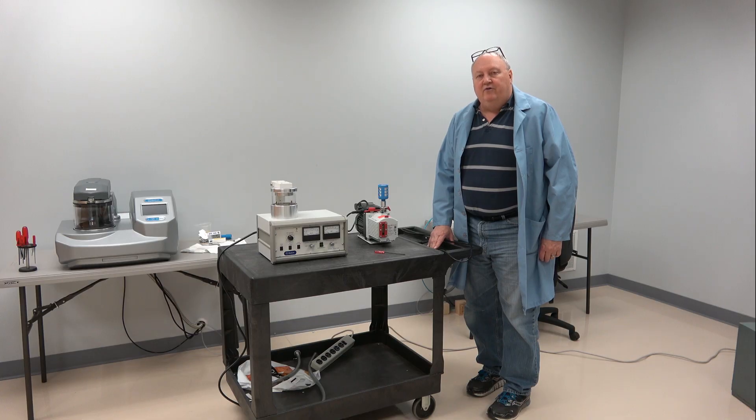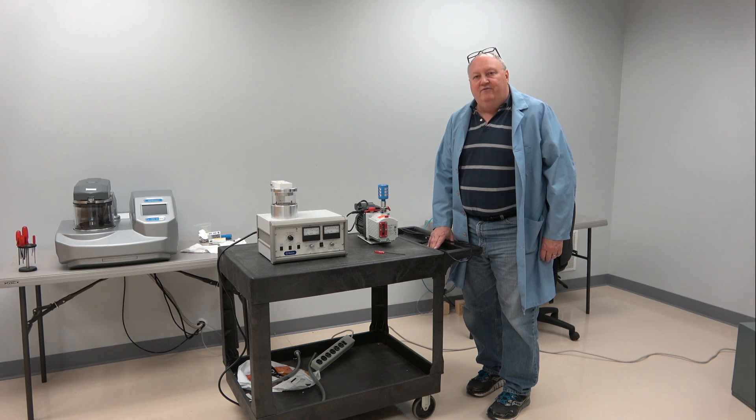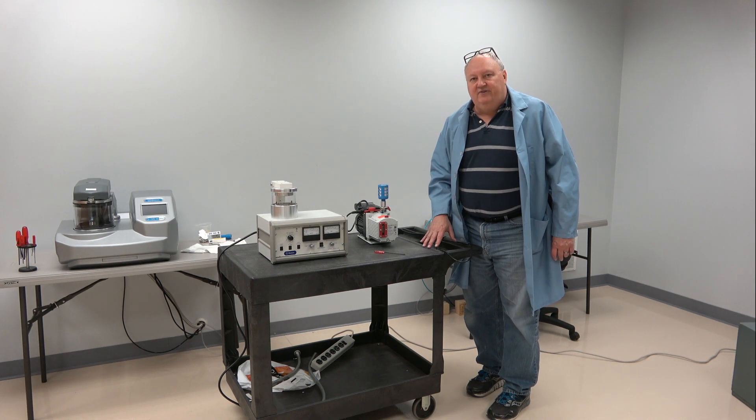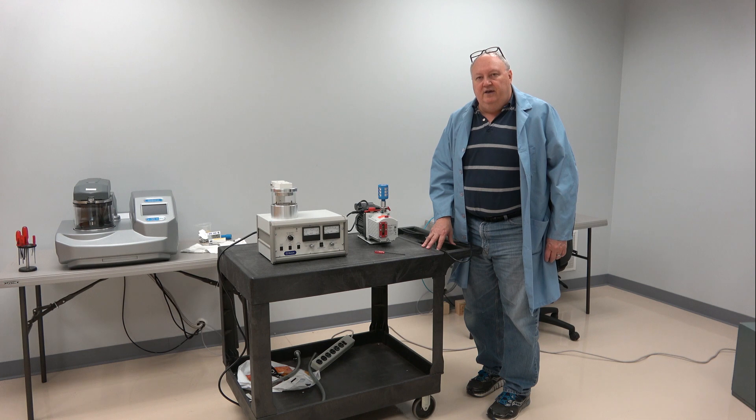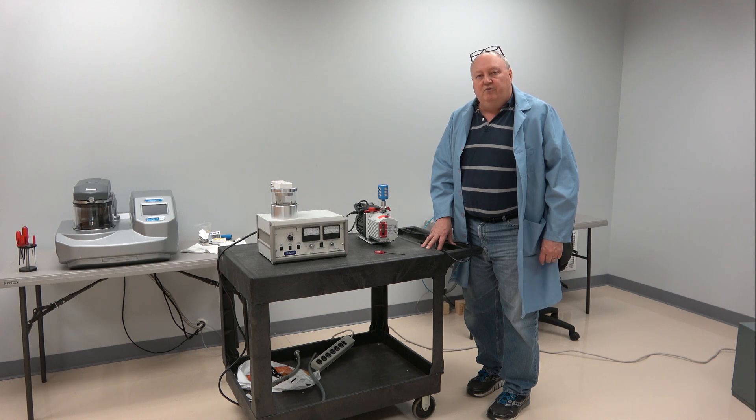Hello, Al Peritz here. I'm the Application and Service Manager for Electron Microscopy Sciences. Today I'm going to be showing you how to set up and operate the mini sputter coater that we offer, the SC7620.